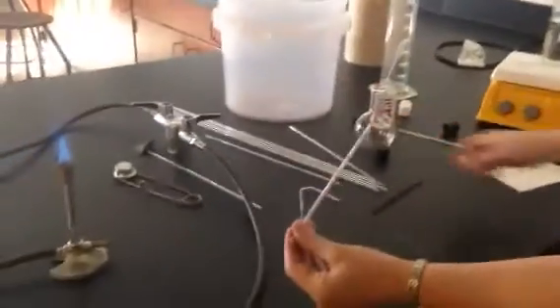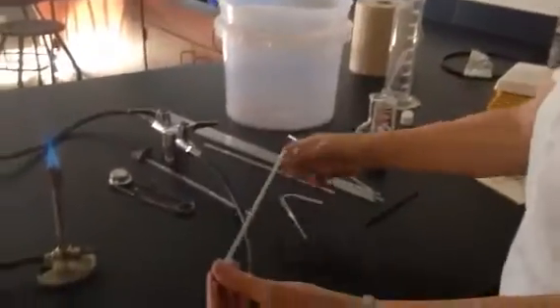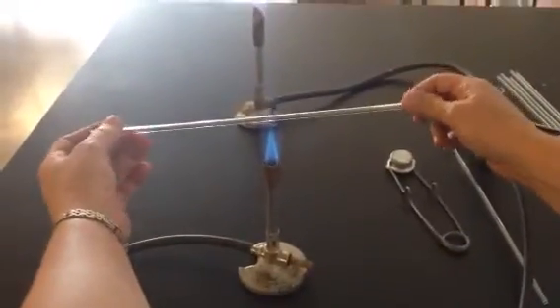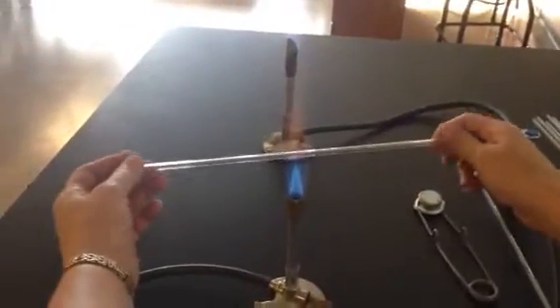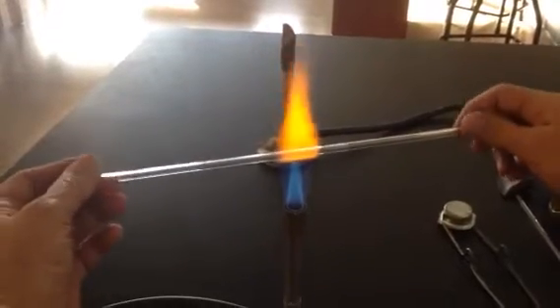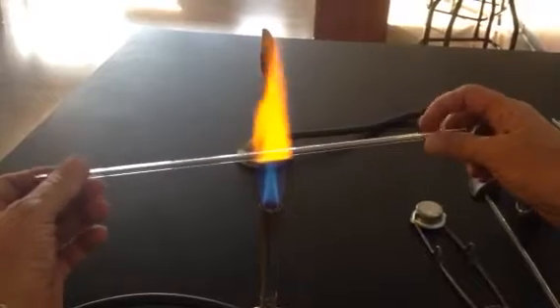Now each piece can get two of these. So I'm going to put the center of this in that flame in the hottest spot, and that's really where the point of that inner blue cone is. And I'm rolling it in my hand the whole time. Rolling, rolling, rolling. And you have to be a little patient. What I find students do is get a little impatient. You want the glass to be really wobbly before you pull it.